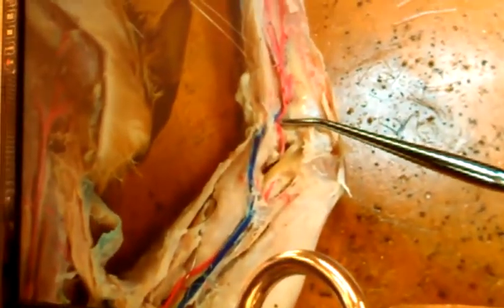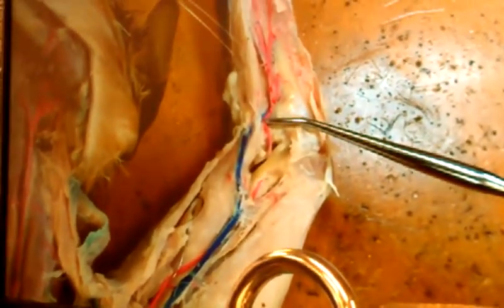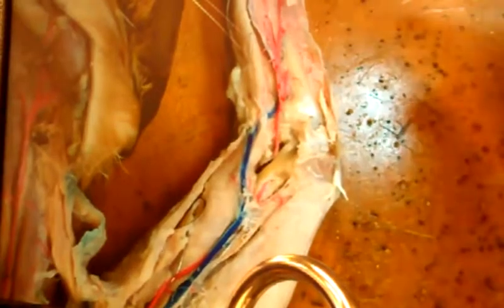You can see that move. So, Mr. Gilmore, it's brachial till it reaches the supracondylar foramen. But when I get around to the other side, Mr. Gilmore, what are you going to call this if you tag him right here? He is now radial. If he's radial now, Mr. Gilmore, notice the radius is going to keep going toward the what? The thumb. So he's going to stay medial.